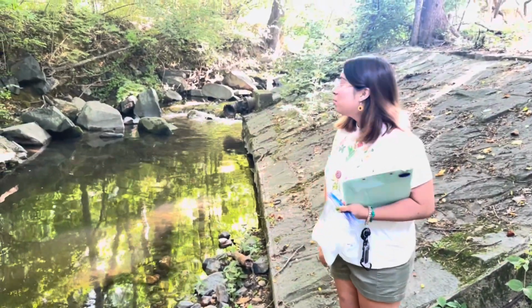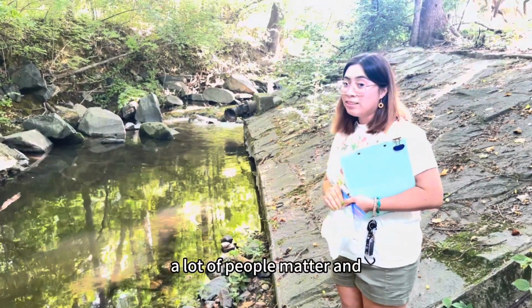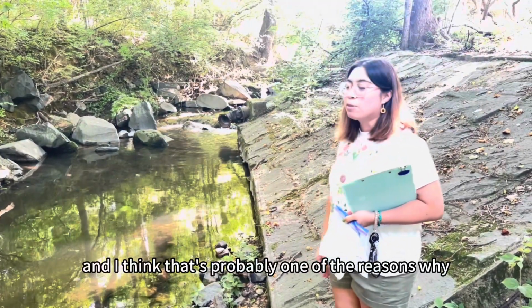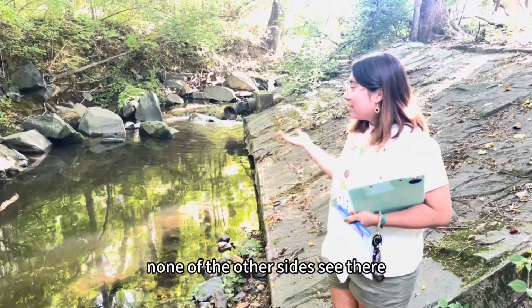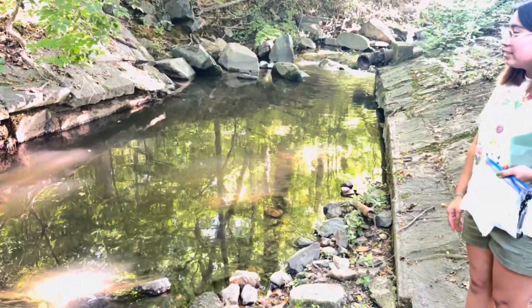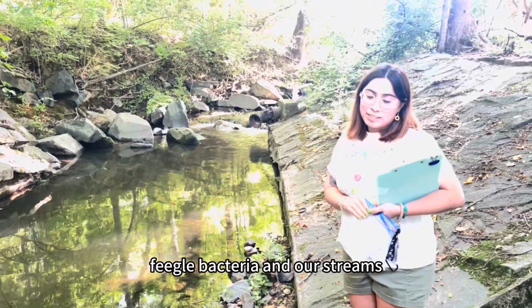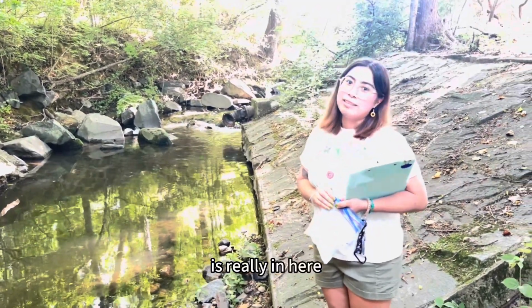So we are at one of the sites that has a lot of fecal matter, and as you can see, they dump here a lot at this site, and we think that's probably one of the reasons why we have a very high number. None of the other sites see this, and you can see the color is a little grayish right here. It's really impacting the levels of fecal bacteria in our streams, and that's why we're testing to see how much is really in here.